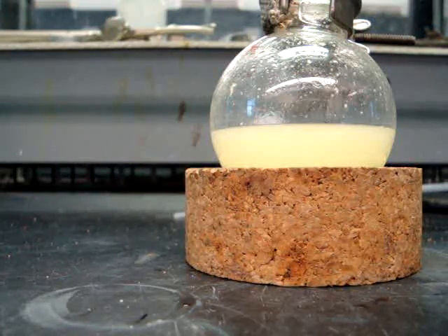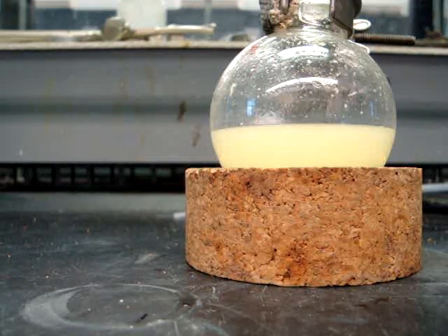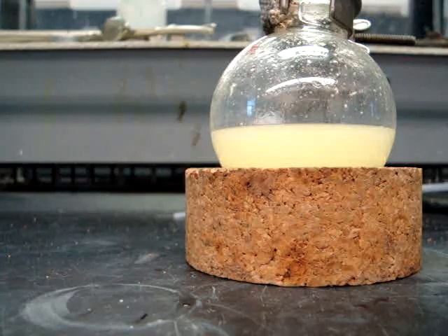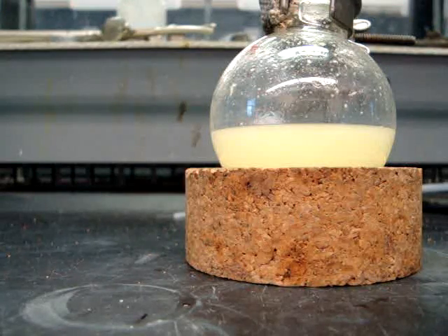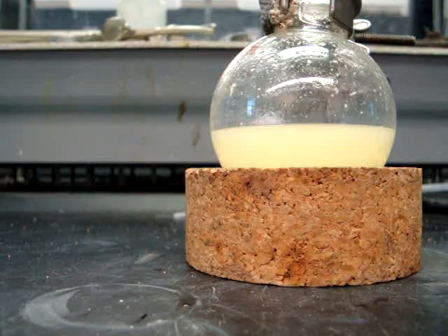Then you will recrystallize the crude product using 70% ethanol. If you have any questions regarding how to recrystallize your crude product, refer back to the recrystallizing video.